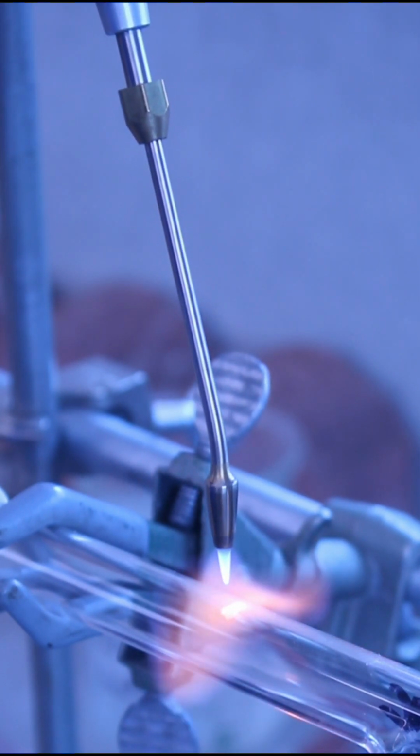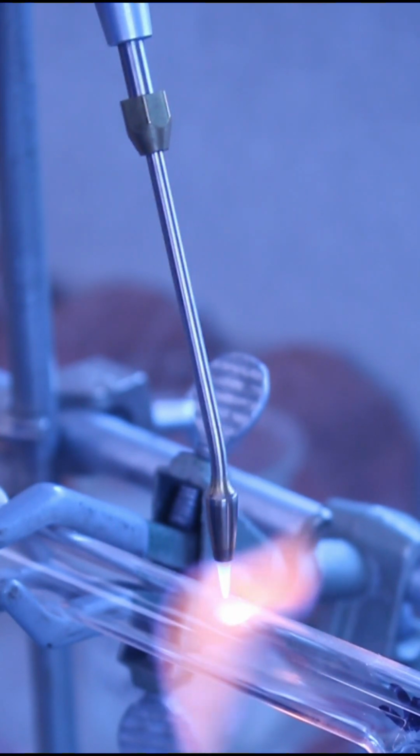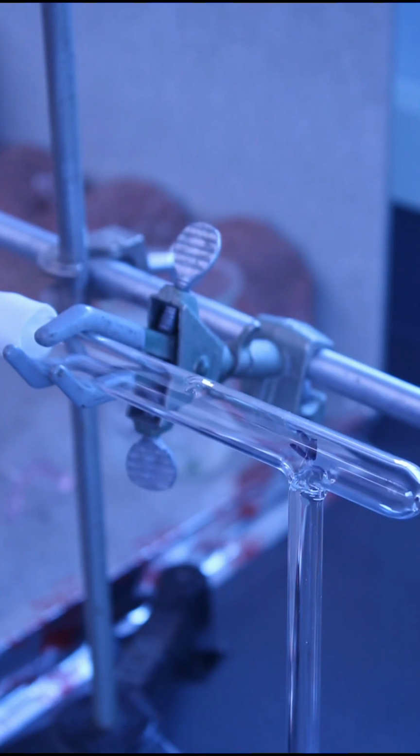And as the glass begins to soften and collapse, I pull away the torch. And then I puff into it. And I'm going to repeat this a few times.